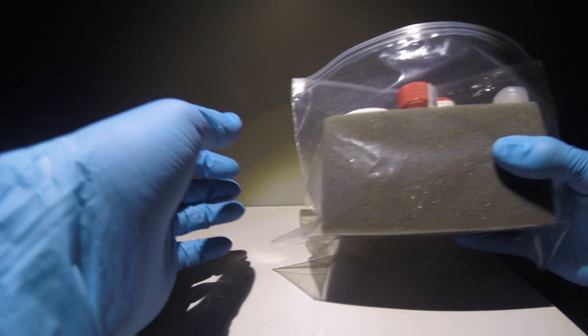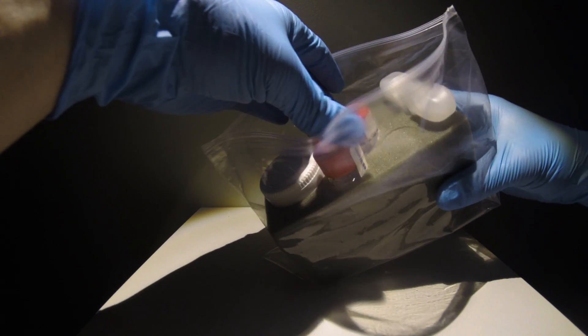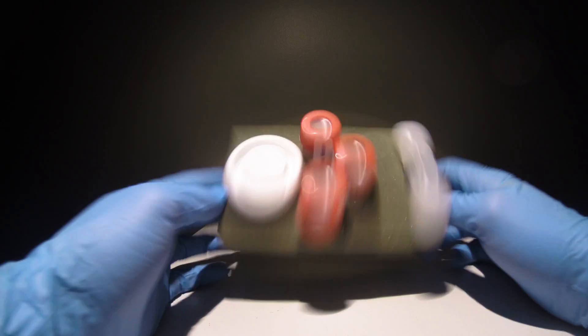Once you receive your TerraCore kit in one of our coolers, be sure all necessary articles are present in your foam container.